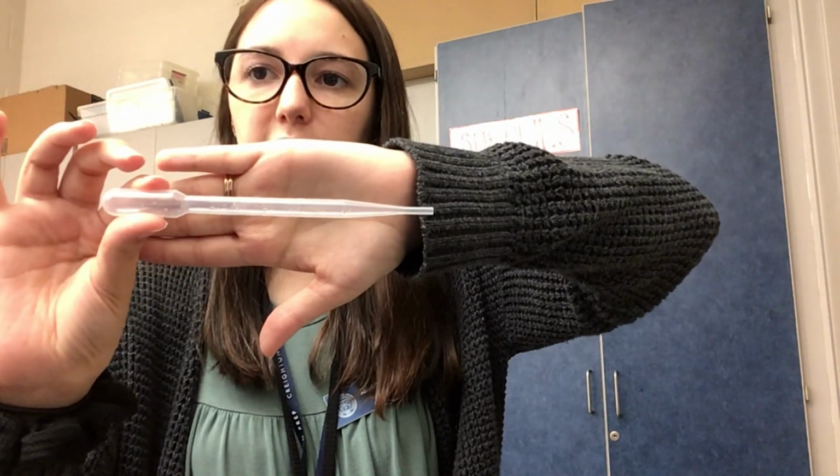And finally is my pipette. We've used these a couple times in lab already. I will suck up water and I will poke it out. There are different types of pipettes. There are ones that are bigger, there are ones that are smaller, surprisingly, because there's micro pipettes. However, typically we'll use one of these in the lab because it's a lot safer. It's also a really safe way to move substances or get your samples for the lab.